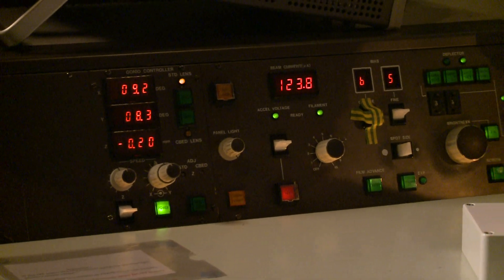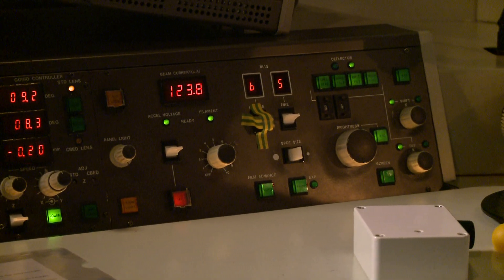There's a lot of computer control now — you can see illuminated LED panels and lots of computer controls here. Initially, everything was mechanical: you had to operate the strength of the focusing lenses by turning dials, which mechanically changed the currents going through them. Now it's nearly all electronic — a huge difference.